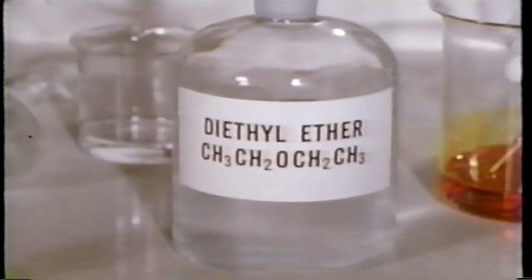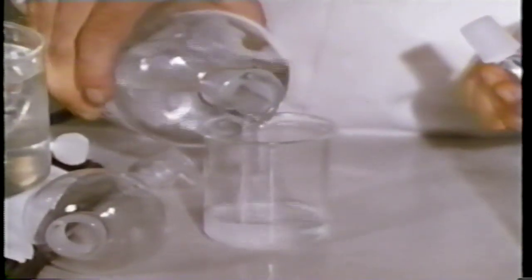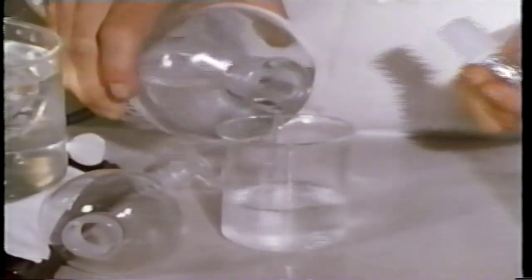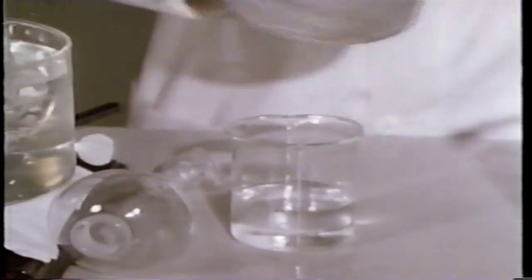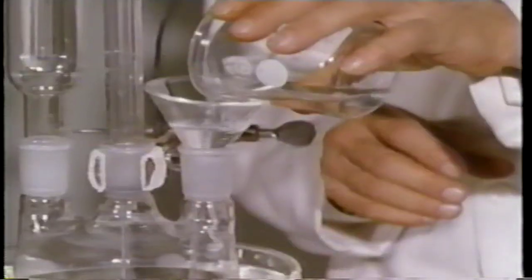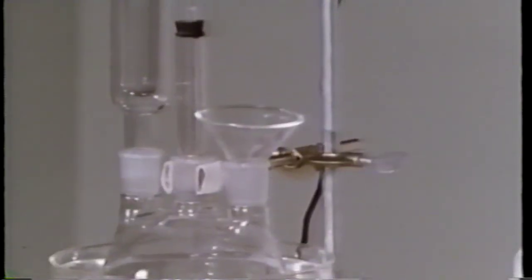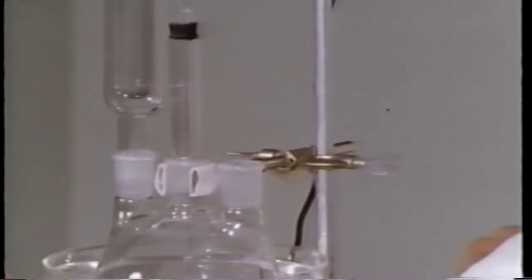Before adding the reagents to the reaction flask, Geisman uses diethyl ether to dissolve the butanol. The amount of ether added to the butanol is not critical because ether is not consumed in the reaction. Rather, the ether dilutes the reaction mixture so that the rate of reaction can be more readily controlled. Also, the product ketone is much more soluble in ether than in water. This property will be helpful in the purification stage.